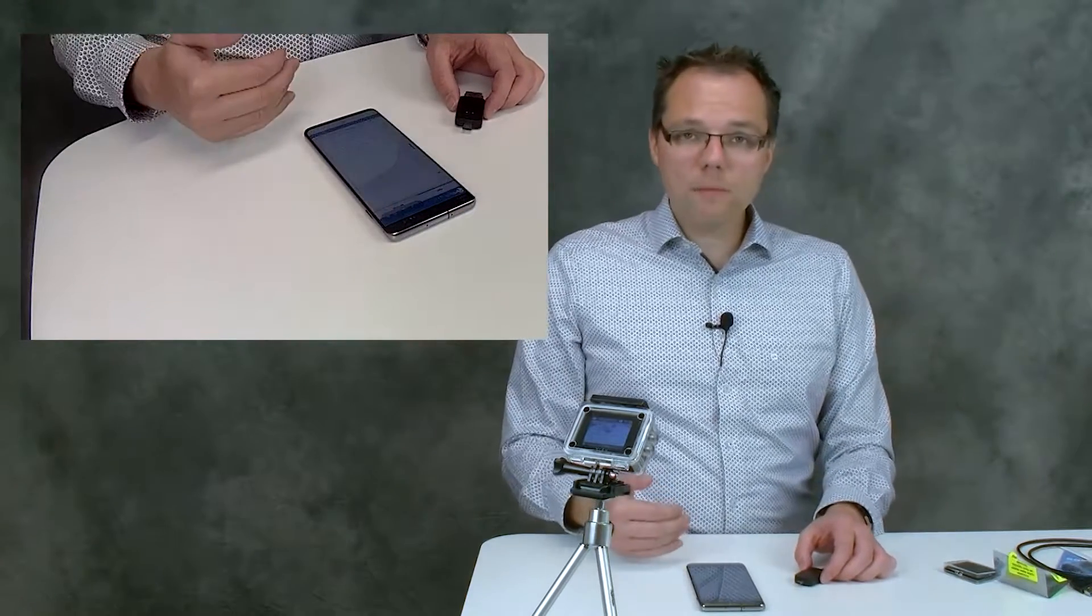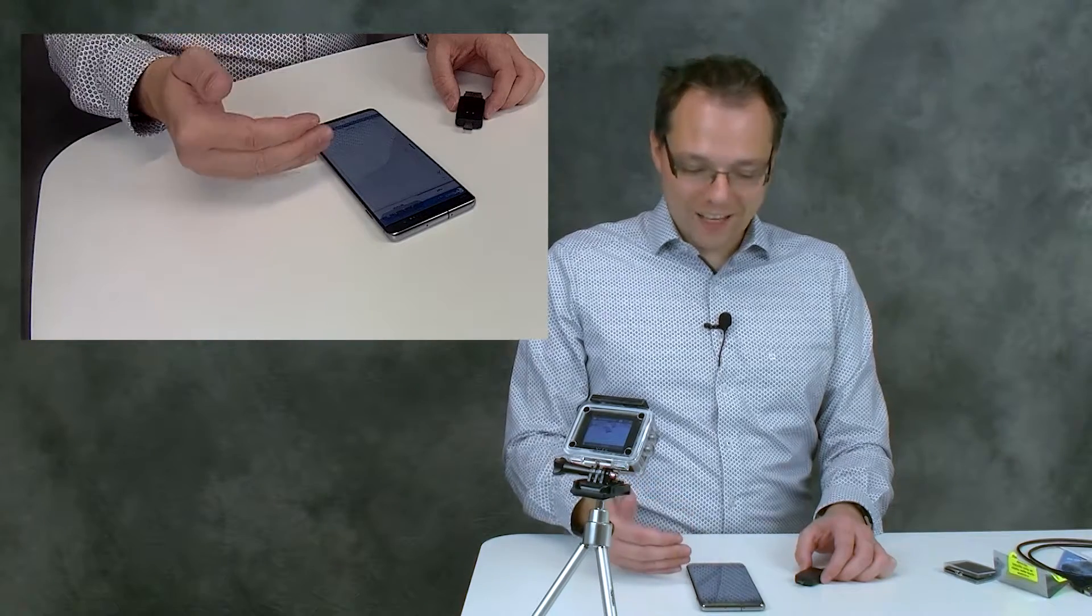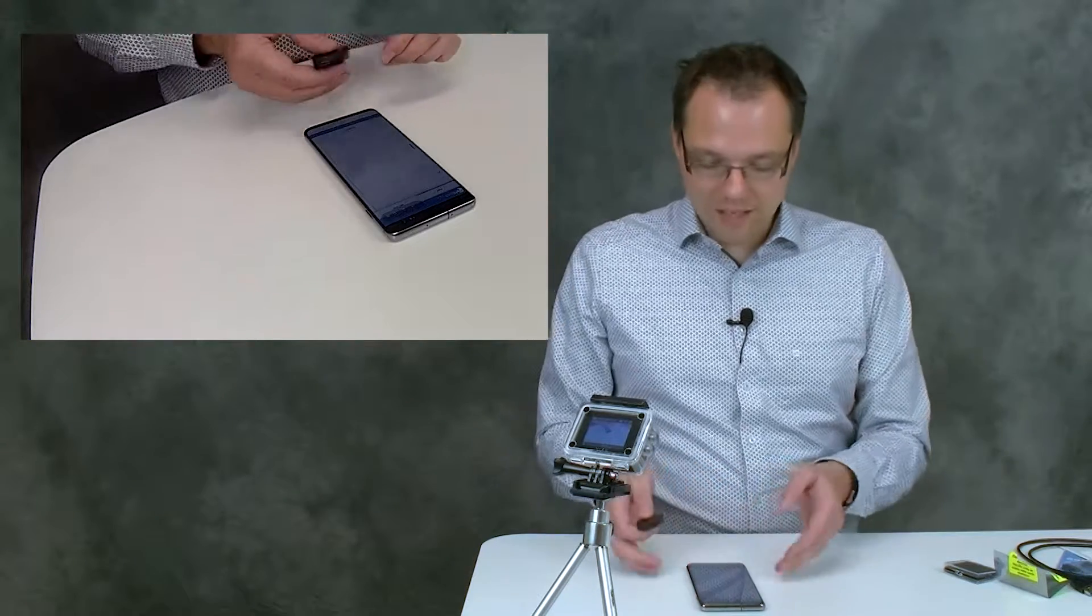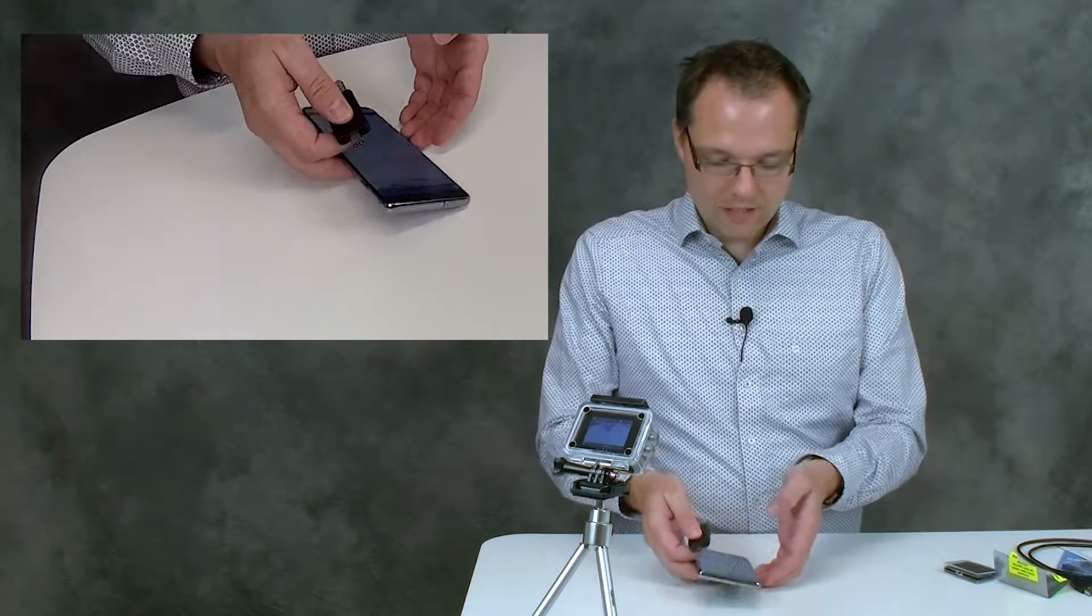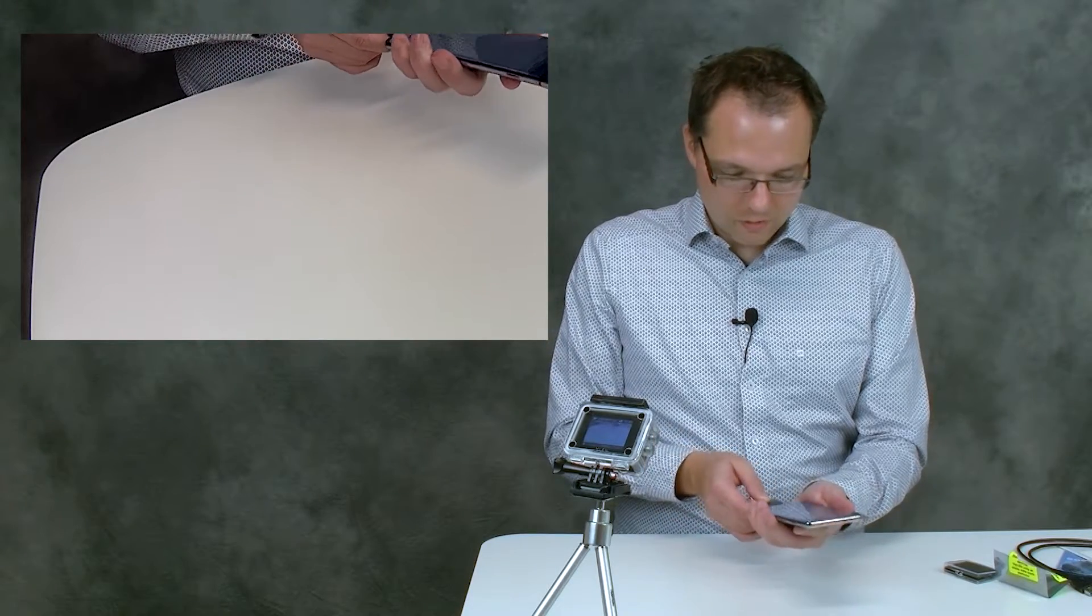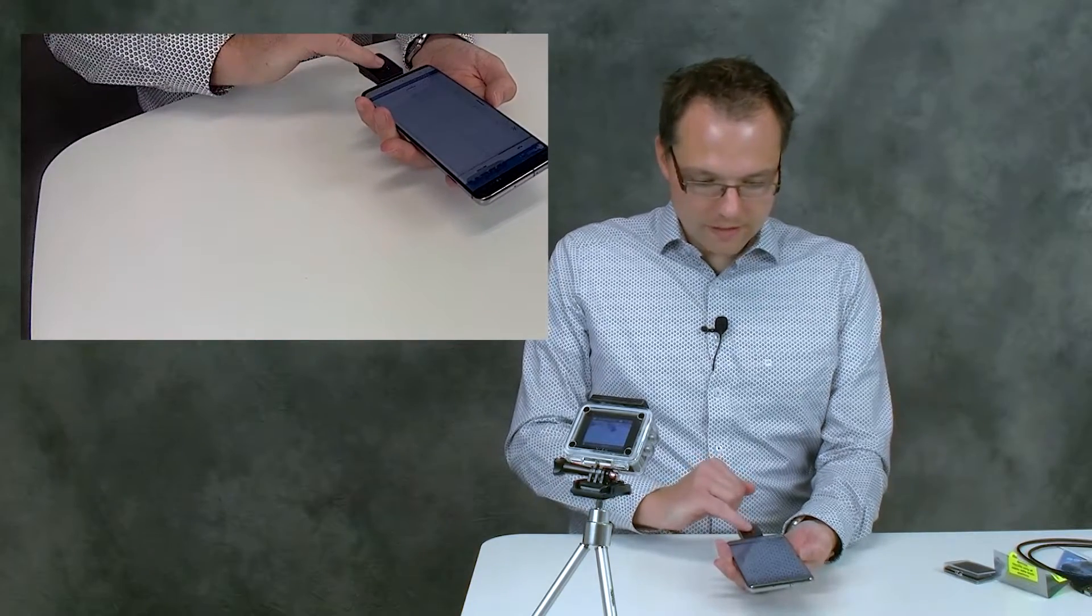When it's the first time that you open PS Touch, you will get some tips and advice that we would like to give you. You can just close that and then start with your measurement. So I connect the Sensit Smart to the Android device, and you see it illuminates.